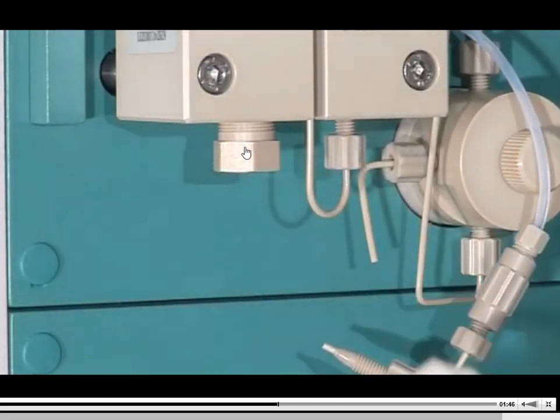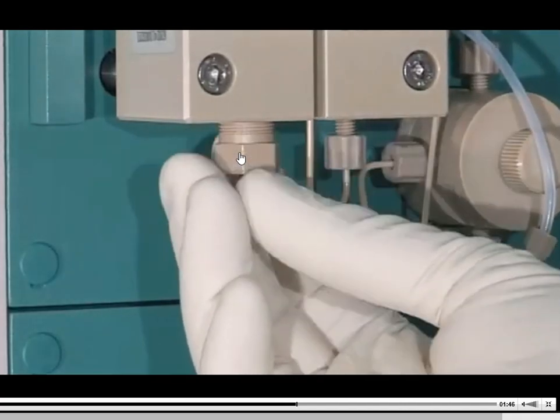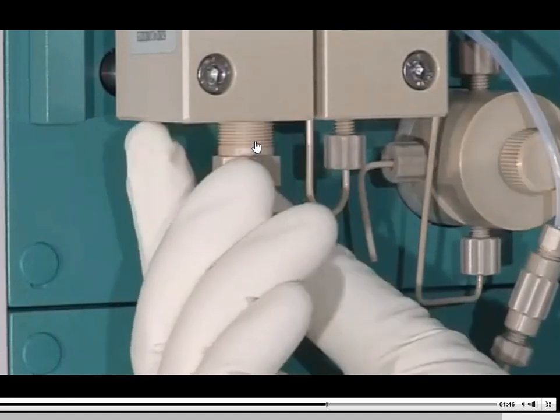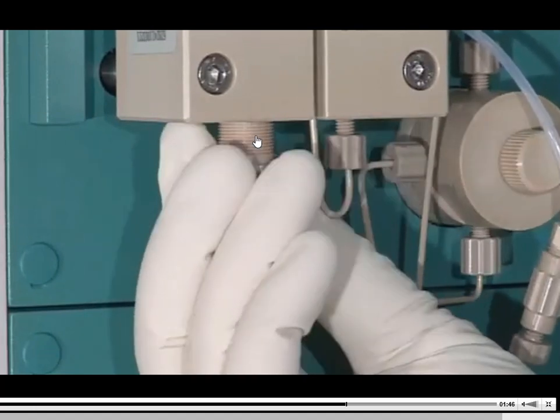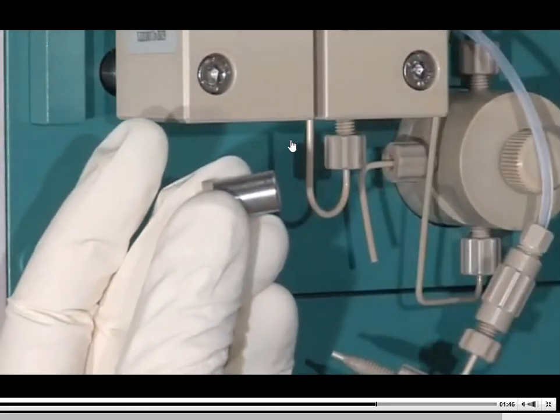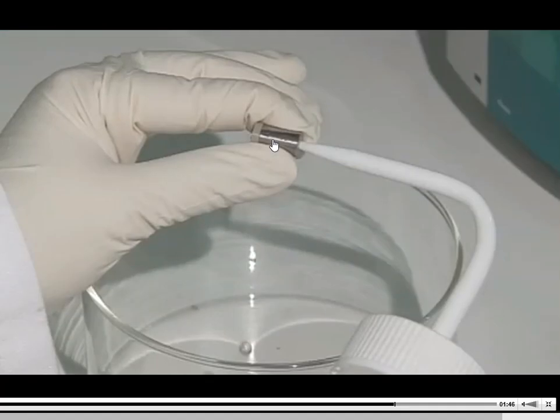There's also a bottom one here as well, so they're going to take the bottom one off and do the same process there. That just gets unscrewed, and then you take that inner filter, as I view it, and that slides out just like the top one did. It's basically the same size and the same part, really. There's no differences in them at all. And then they're going to do the same thing there.